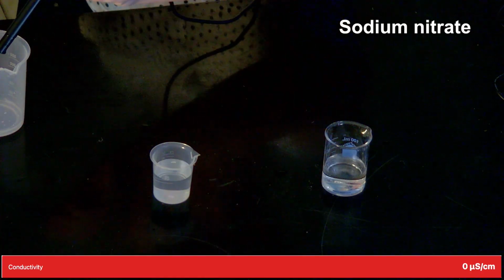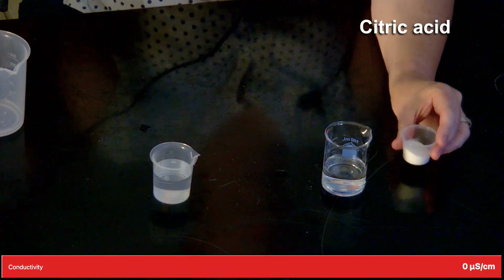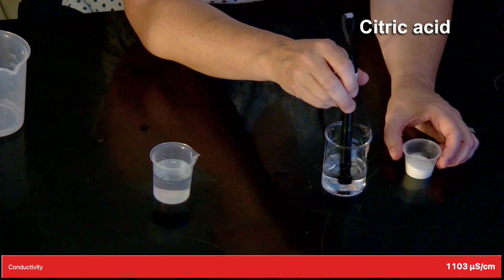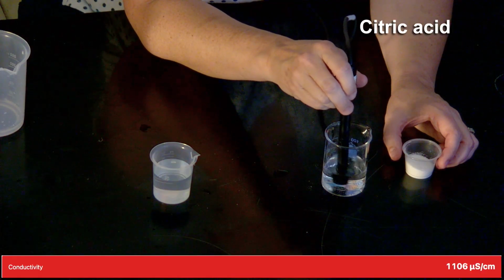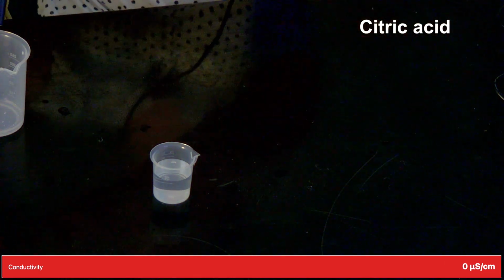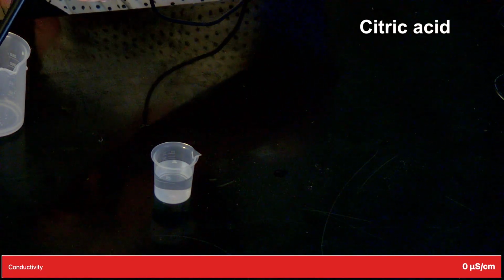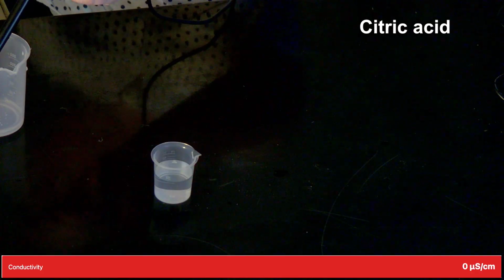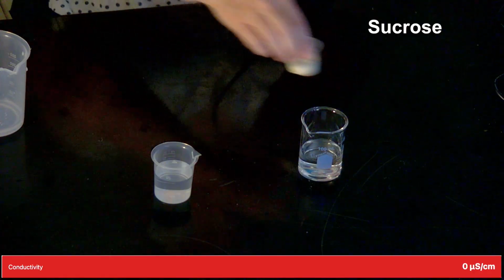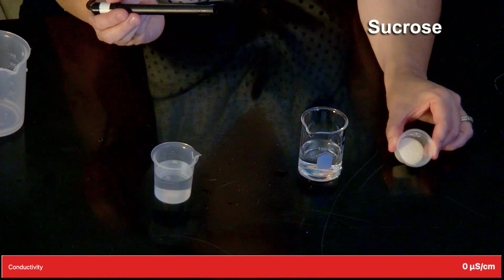Citric acid is next. Also a white solid, granular. The next substance is sucrose. And this one is definitely more granular.